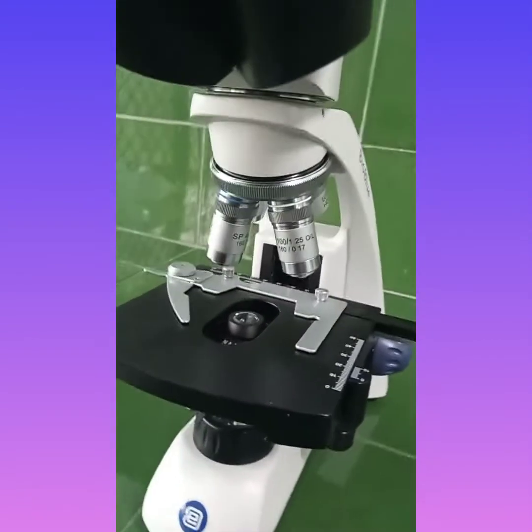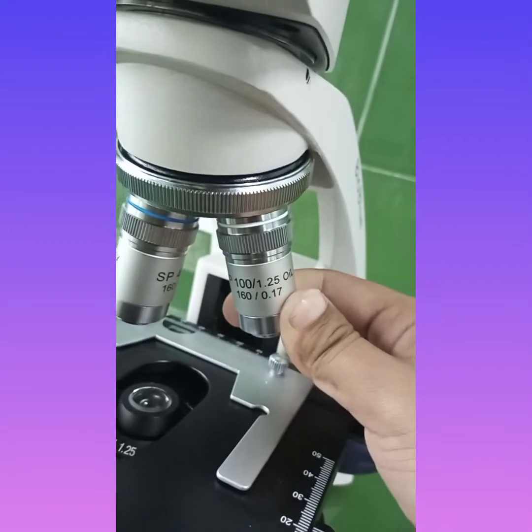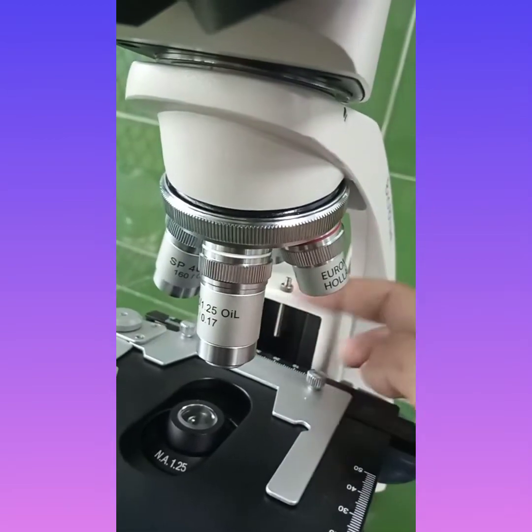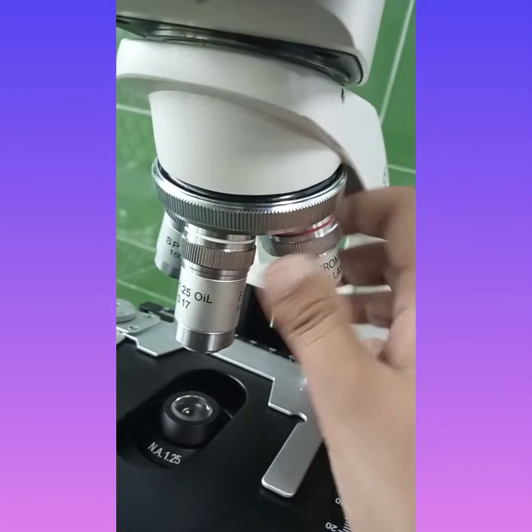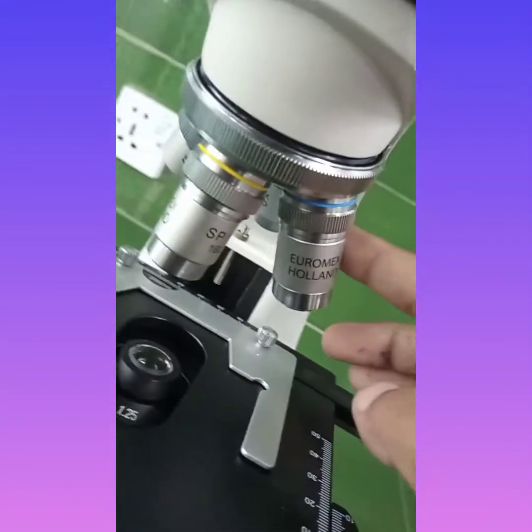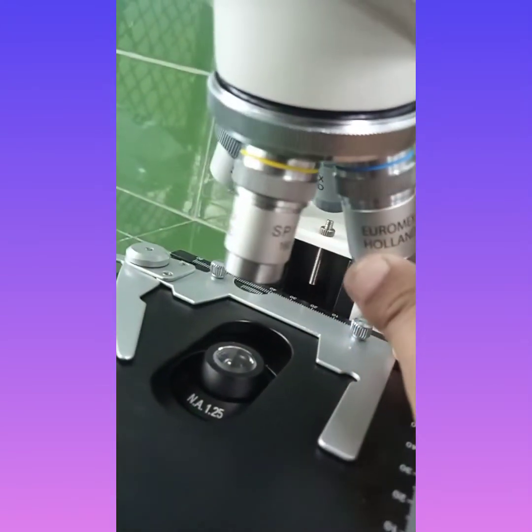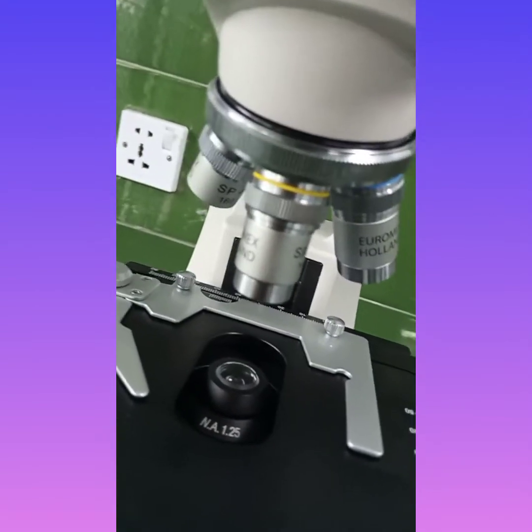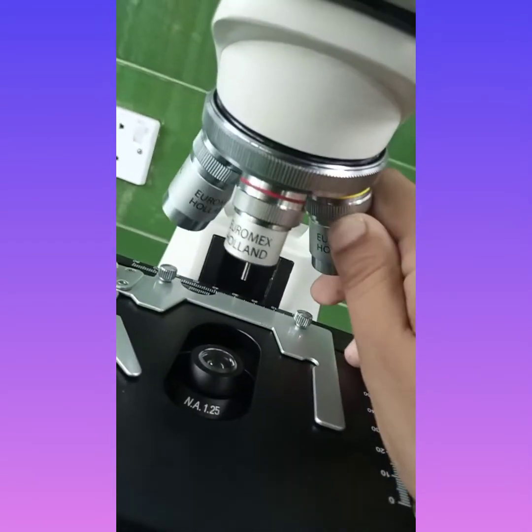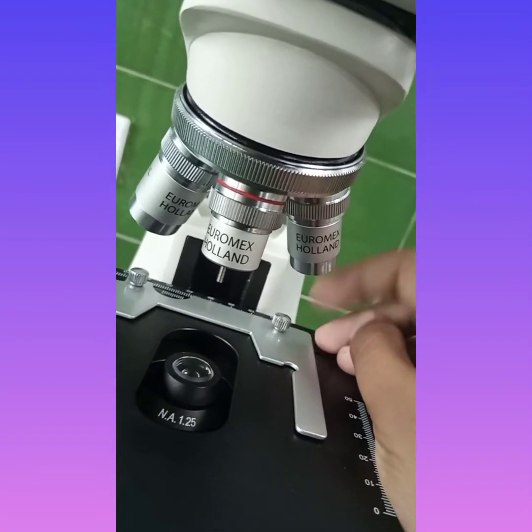This movement will help to observe better results, and will help to place our smear right above the lens which is present below the stage. Now these are the objective lenses, which are shown here in grey color. These objective lenses are of different magnification. The most commonly used magnification is the oil immersion magnification, which is 100x. There are several magnifications which are used, for example 10x, 40x, 60x and 100x oil immersion. However, the drop of oil is only used in the case of the 100x magnification. No oil drop will be used while dealing with the 10x and 40x magnification.